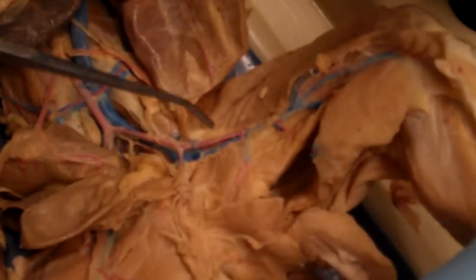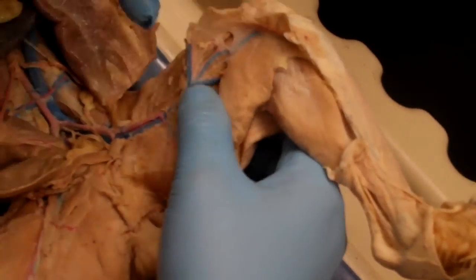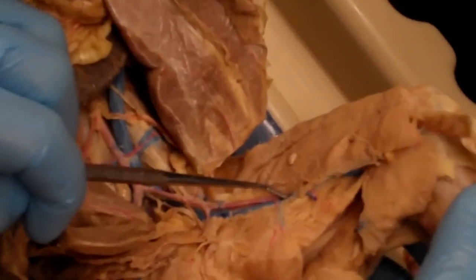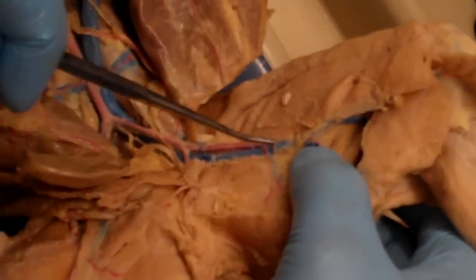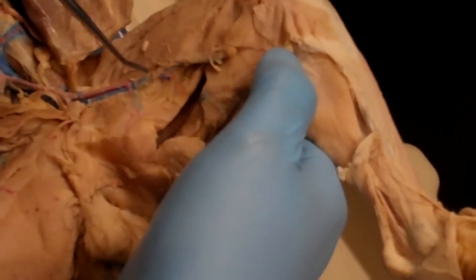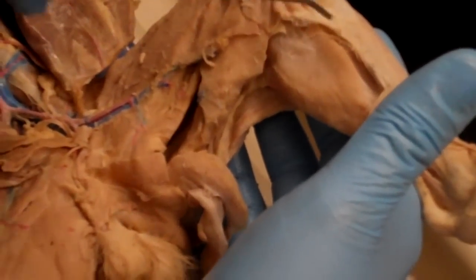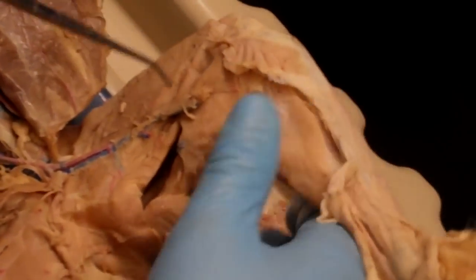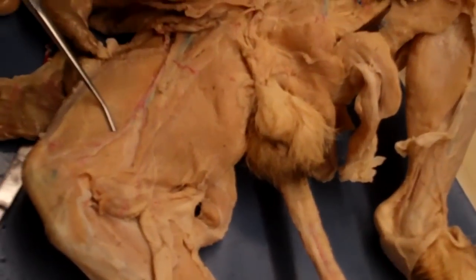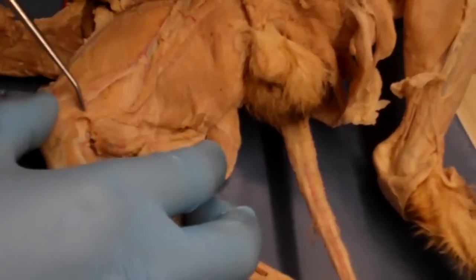The saphenous is not completely dissected out. We really need to dig more. What happens is, right about this point, the femoral artery is going to dive into these muscles, but it has a really thin continuation. A lot of times it's lost when they skin these guys. So what we should see is a small artery coursing right here, and that'll be the saphenous. This isn't a great example of it. Yeah, this one's okay. Again, it's not perfect, but you can sort of see it right there. This is going to be the saphenous artery.